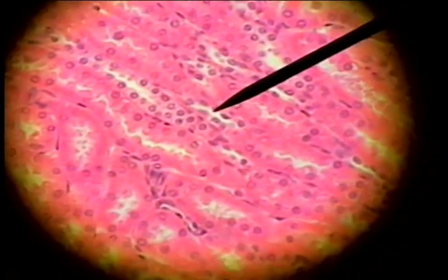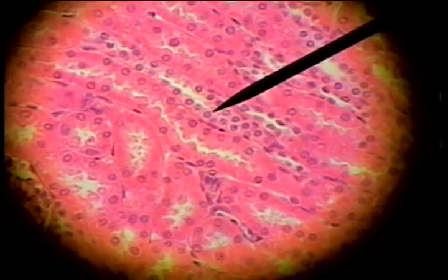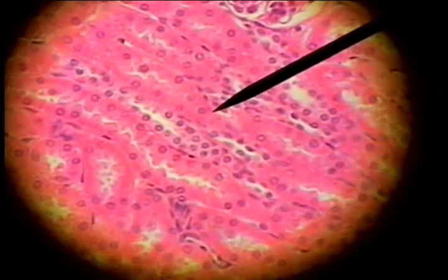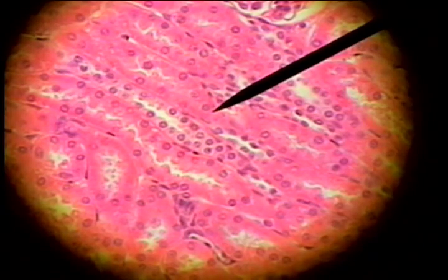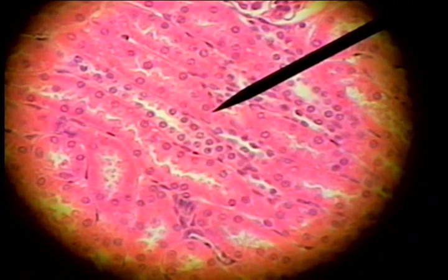These lighter staining tubules are the distal convoluted tubules. Here's a lighter staining distal convoluted tubule cut longitudinally, and right next to it a darker staining proximal convoluted tubule.